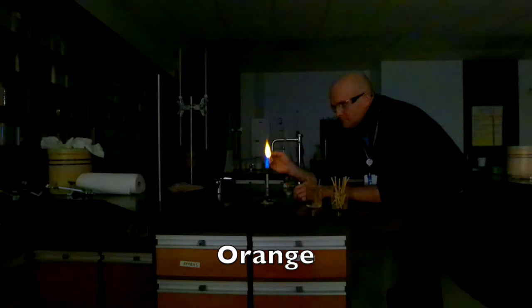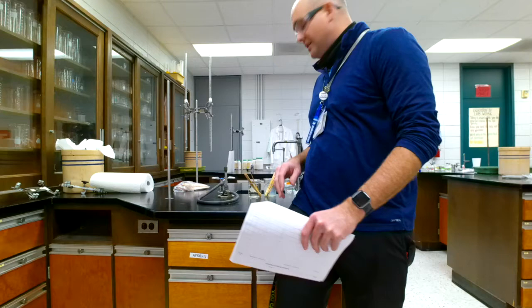Okay. And the last one. You can use flame tests to determine what a substance is, or at least to help narrow it down. So here's your unknown. What could it be? So I have extinguished the flame and made sure everything is safe and sound. No, nothing's on fire anymore.